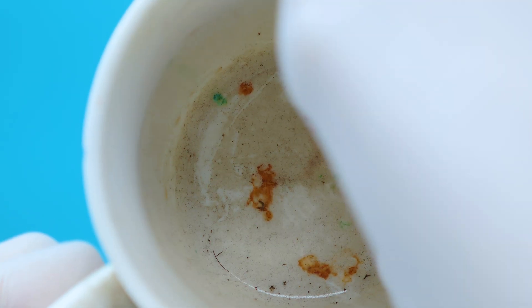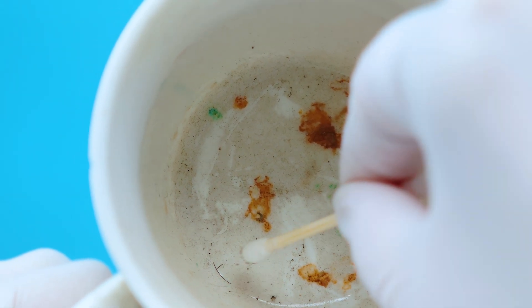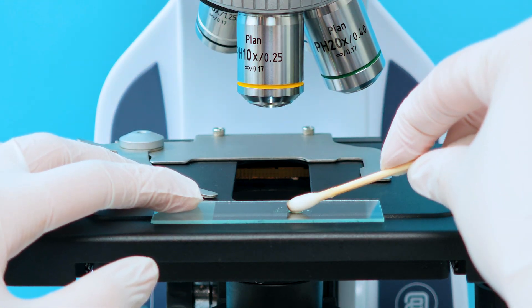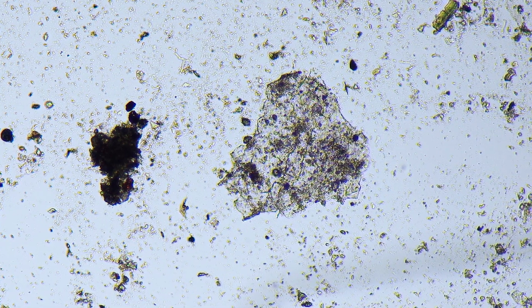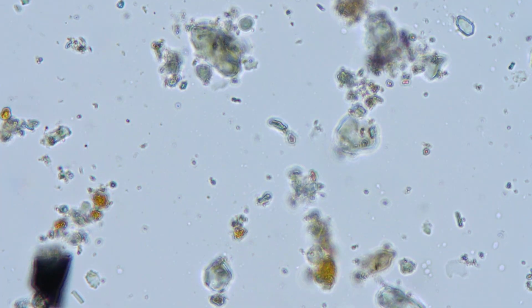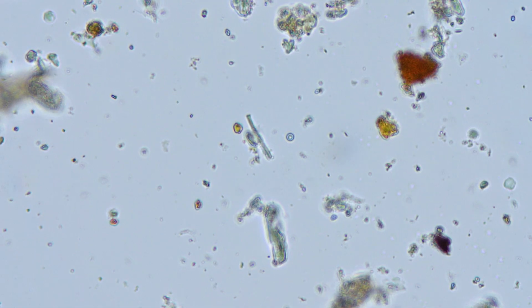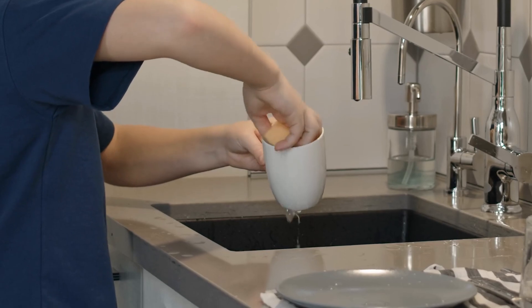The bottom of the cup, often overlooked, is a miniature biological lake. Toothpaste residue, white film, saliva, and oral cells pile up every day. Under a microscope, a biofilm — a sticky layer of bacteria — clings to the cup's walls. And the next morning, when you use that cup again, you're unknowingly reintroducing those bacteria back into your mouth.